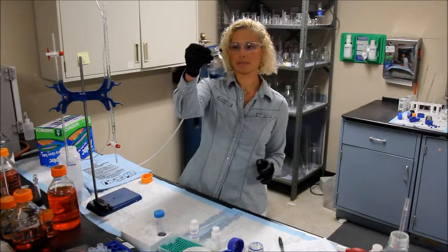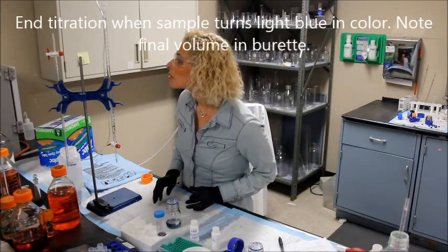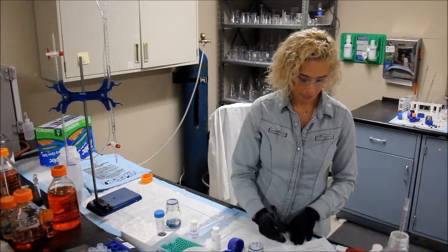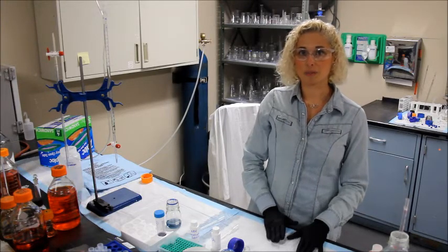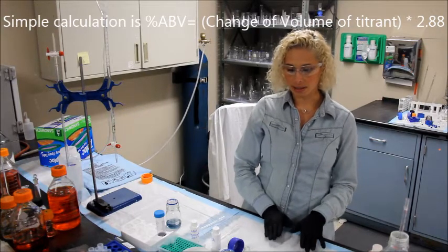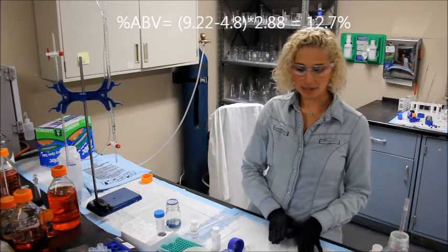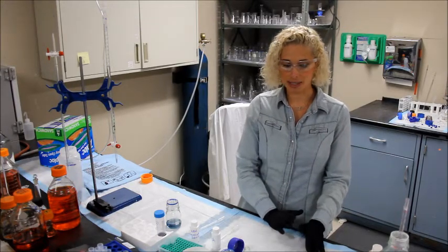I've reached my end point and the final volume on that is 9.22, with the initial at zero. Now you're ready to calculate your results. The simple calculation is to take the difference between your blank and your sample and multiply that number by 2.88. In our example, I got 9.22 mls for my blank and 4.8 mls for my sample. So the difference multiplied by 2.88 comes out to 12.7% alcohol by volume in my wine sample.